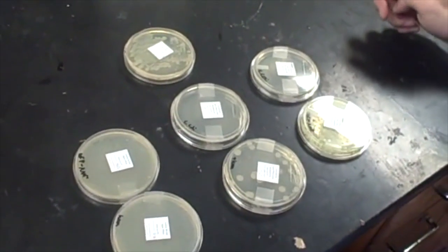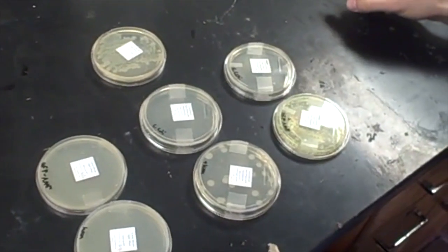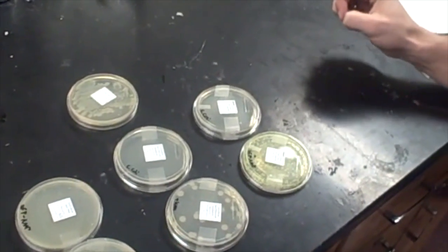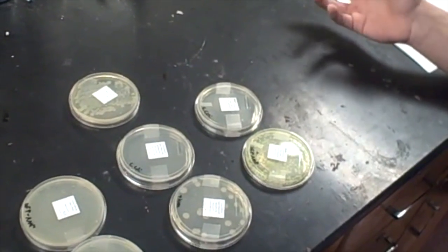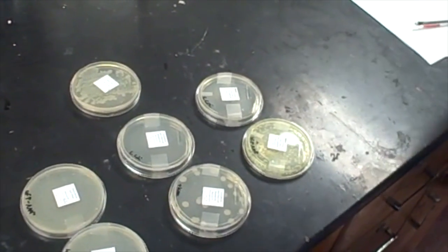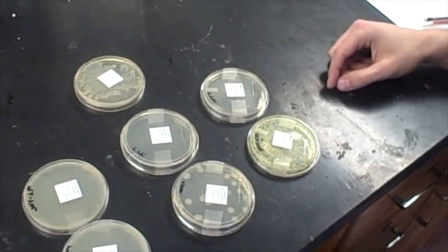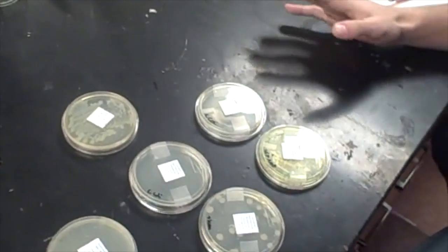That plasmid also had a segment of DNA called GFP. GFP comes from a jellyfish and causes the jellyfish to fluoresce. So hopefully the plasmid will make the bacteria fluoresce too. Then in the other vial we had nothing. It served as our control group.